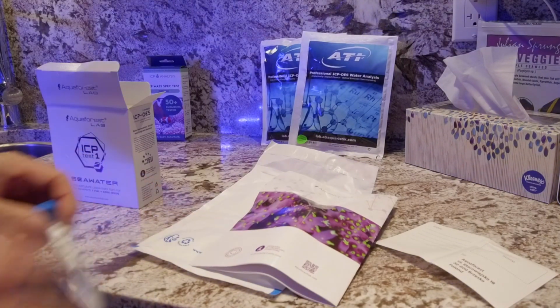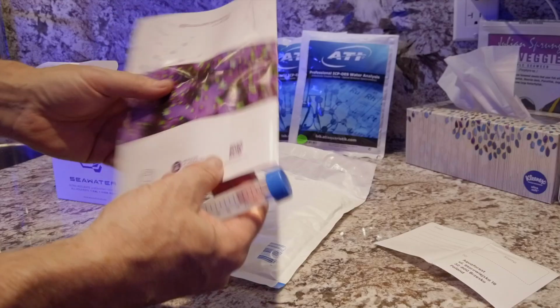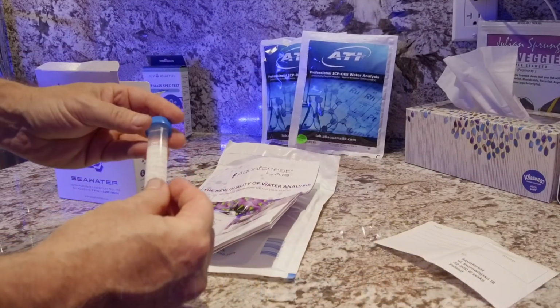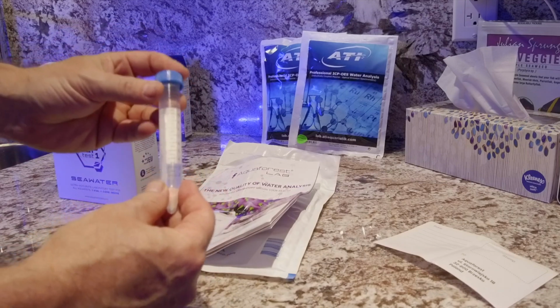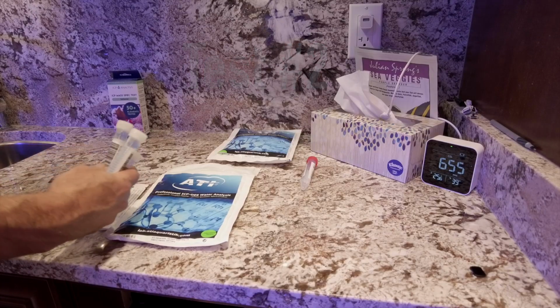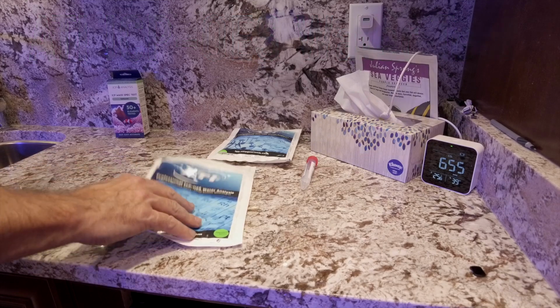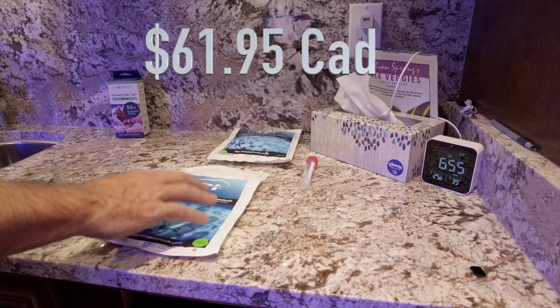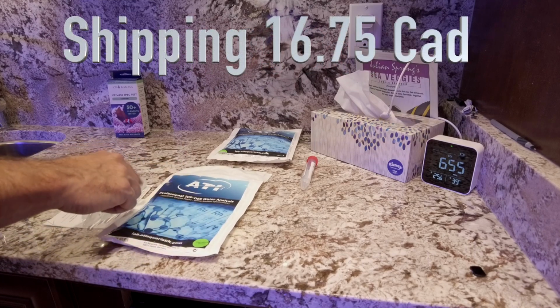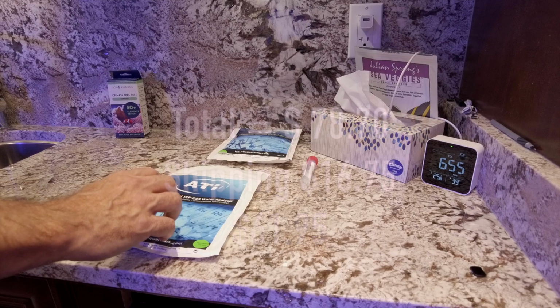So now, we've registered online. There's a little barcode on the back of this pamphlet that you scan and you can create a new account, which I did. We're going to get this sealed up and sent off into the mail today. This is the 3 samples for the ATI kit. It comes with the label and the bubble wrap packaging. We've registered the serial number on the water sample, so they're expecting that. We'll get this off to the mail today as well.